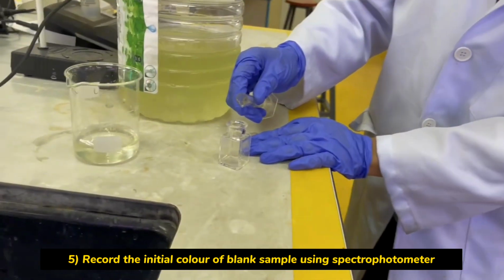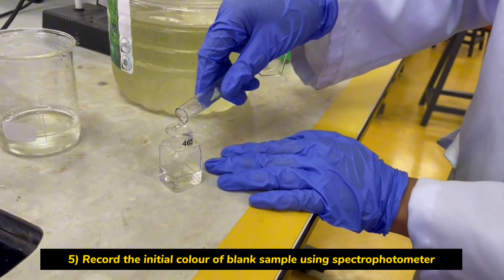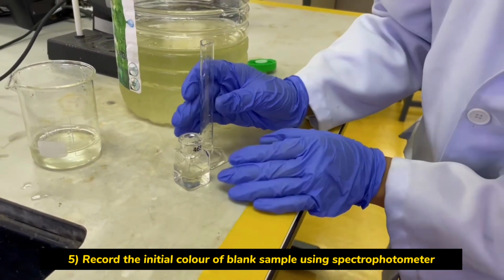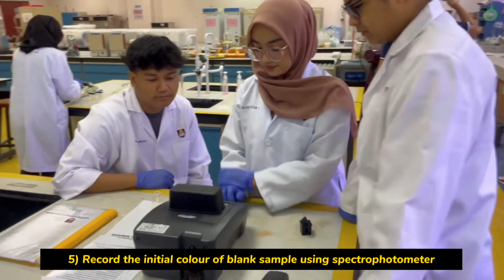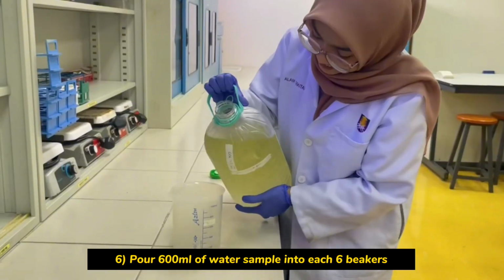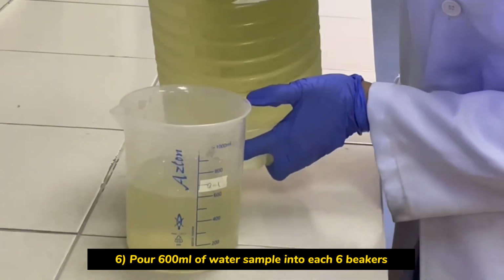To record the initial color of the blank sample, pour the water sample into the square sample cell. Then we use the spectrophotometer to obtain the color value. Next, pour 600 ml of water sample into each of the 6 beakers.